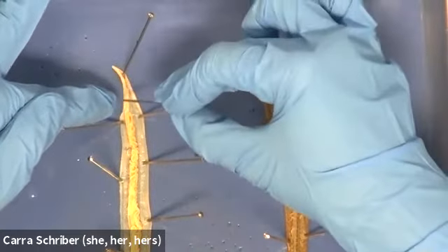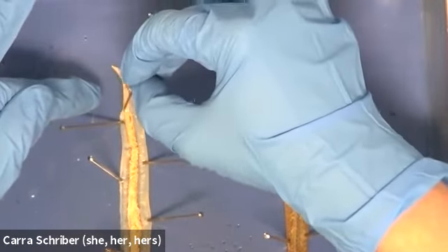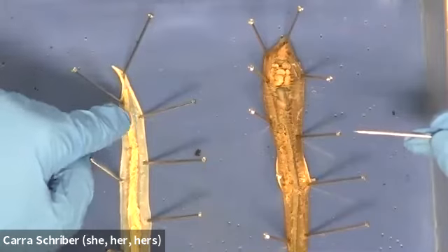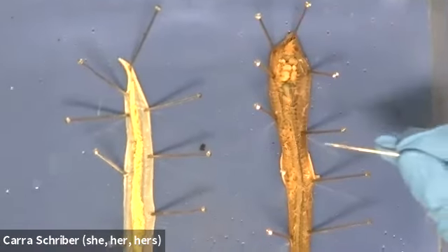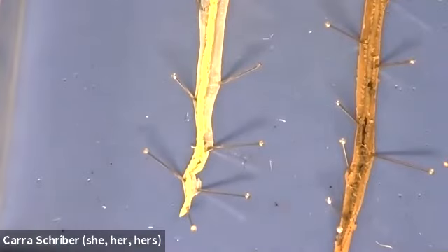There's really not any visual cues for me that this is the esophagus versus a different part, but I just know that after the mouth is the esophagus or the pharynx. And then from there, the whole rest of this is going to be intestine, all the way down to the very, very tippy end, which is going to be the anus.